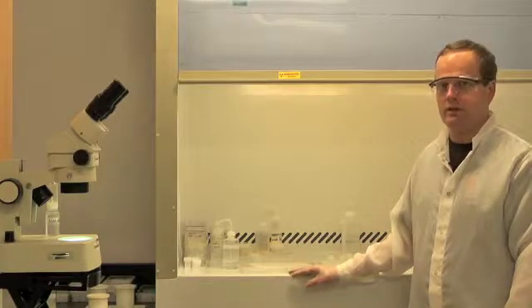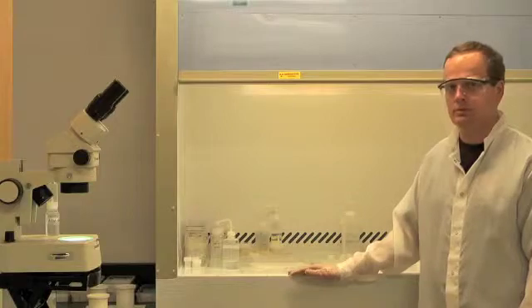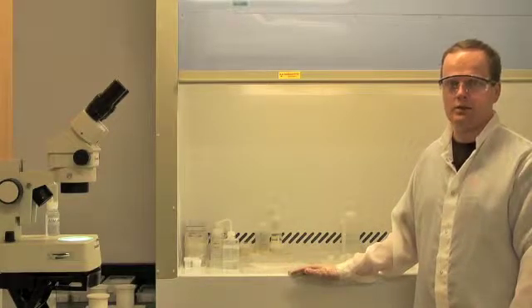Before putting them in the oven, I need to add a spike. A spike is a mixture of enriched isotopes, including 235 uranium and artificial isotopes of lead, such as 205. This spike is how we quantify the number of atoms in our zircon crystal.